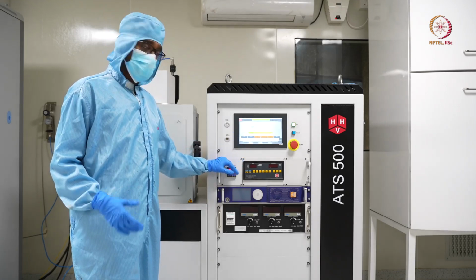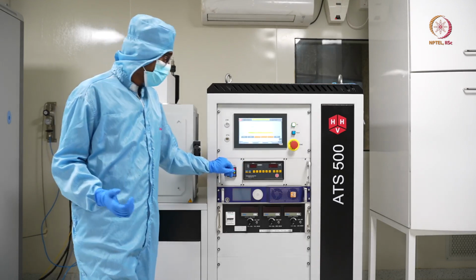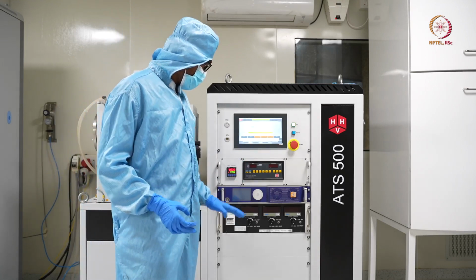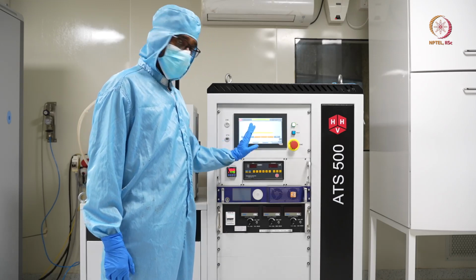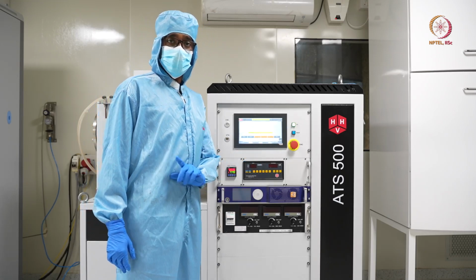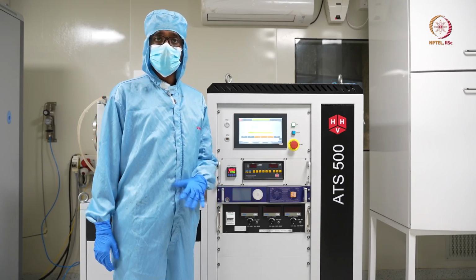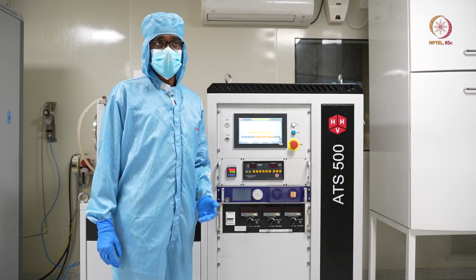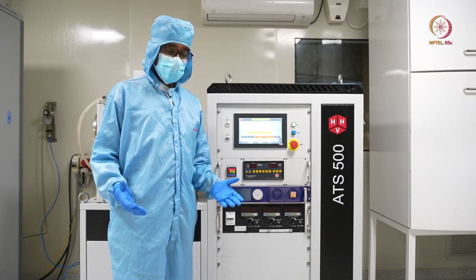So now we are good to go and we can start our process, because the standard practice is that we usually wait till 3 × 10^-6. So it is actually done. After this we can directly go to the process step, but before that we will first switch on the argon supply, because you know that for sputtering argon plays a very important role, which you already know from the theory classes, or will be covered in theory classes.